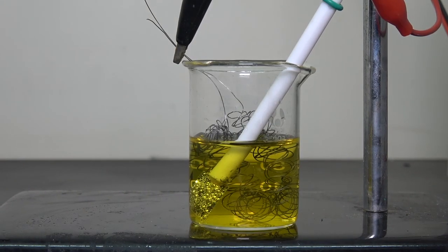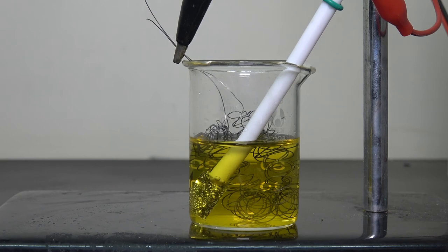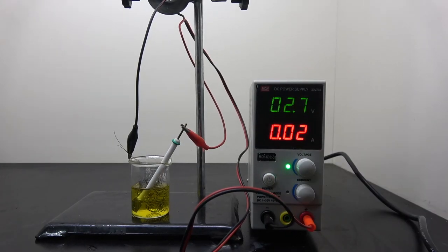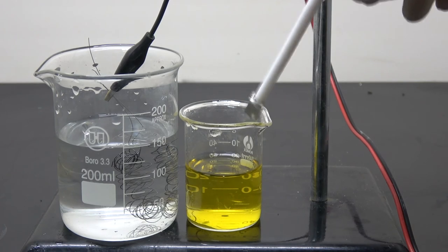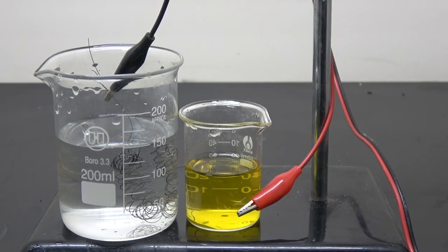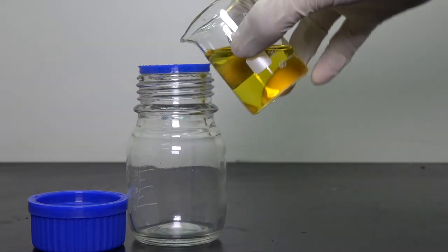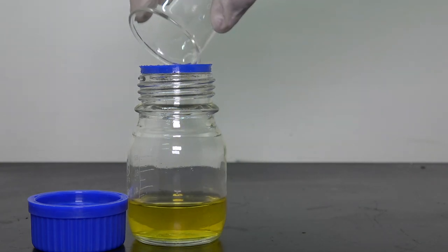For better visual effect, I rotate the beaker so that the marking is not facing the camera. After a half hour of electroplating, I turn off the power and rinse the electrode with distilled water. We are also going to recycle the hexachloroplatinic acid solution for very obvious reasons.